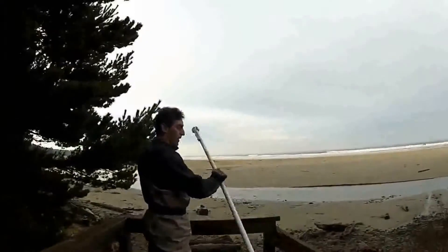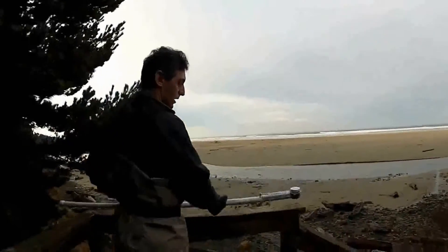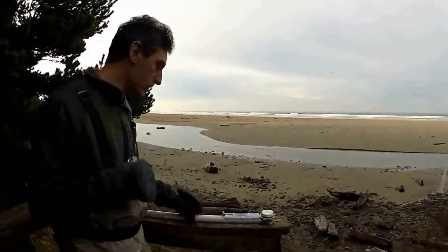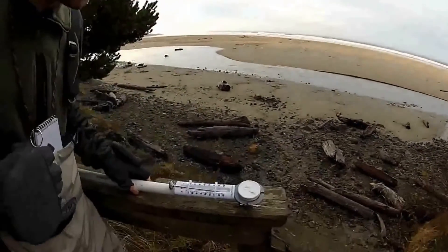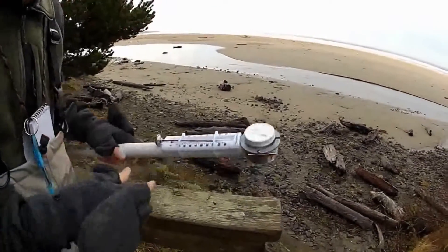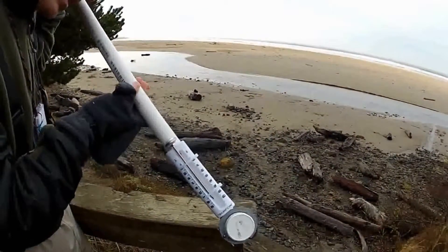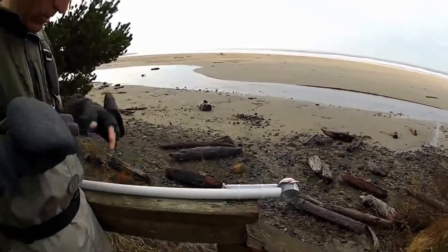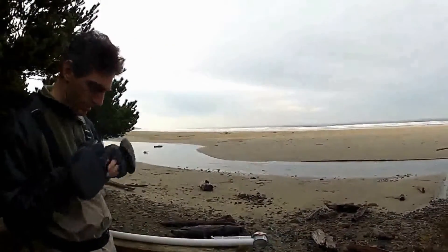This is a good spot to prepare your stick. If you have to do any stick preparations, you can take the air temperature here. We've been outside for a little bit, and I'm looking at the thermometer — I've actually got two of them I'm trying out to see which one I like better. They're both reading about 48 degrees.